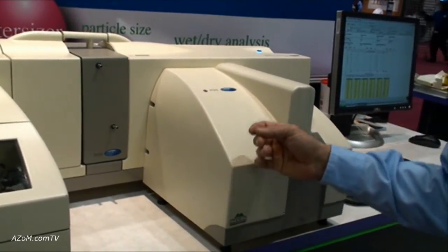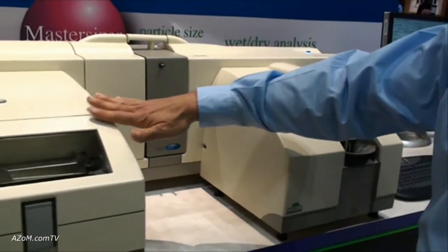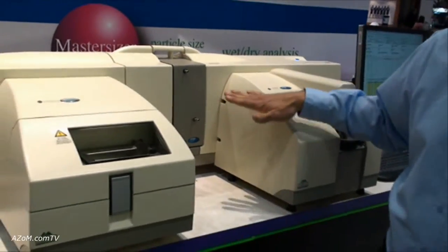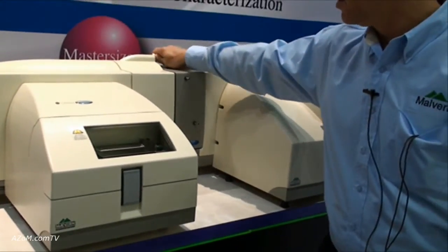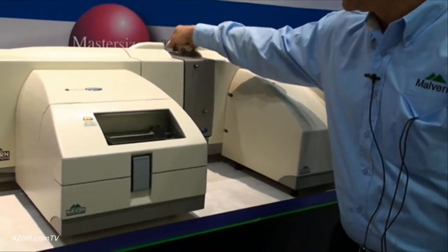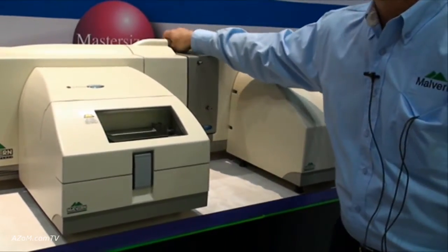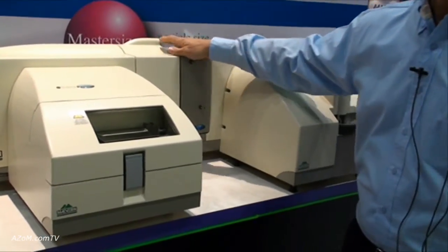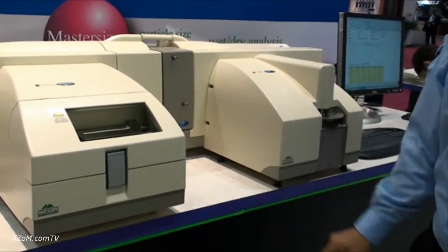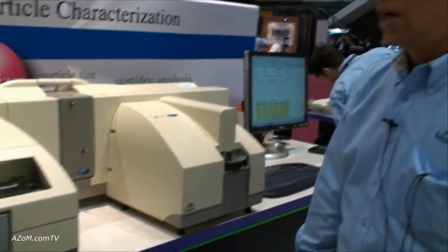It's very easy to change from one module to the other. The disperser unit itself stays on the bench, and a cassette mechanism, which is here, is simply removed from the bench and exchanged for the wet or the dry, depending on which you're measuring. It's all very easy to use, very rugged, and a reliable system.